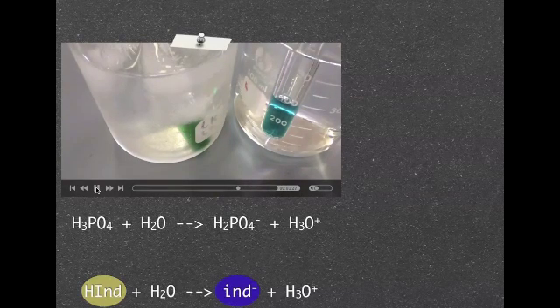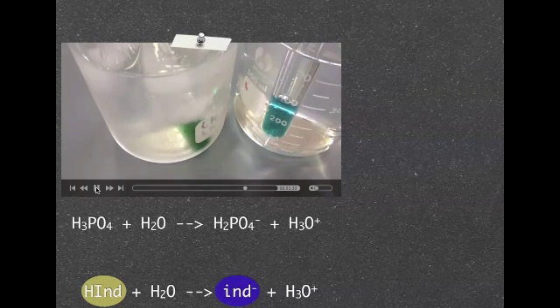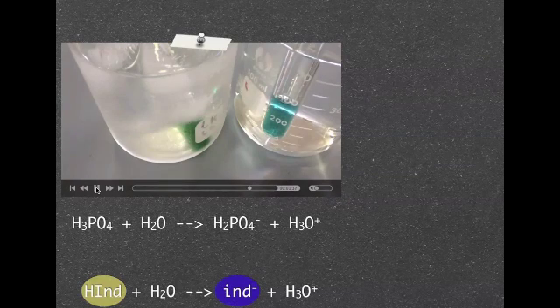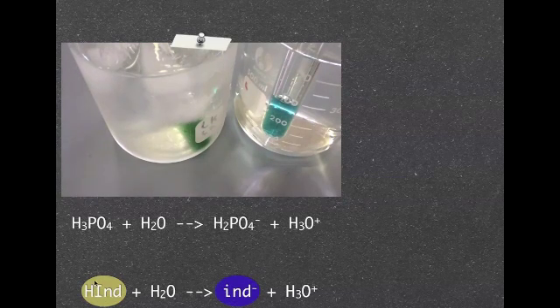You can see it pretty clearly there that the one on the right hand side has gone more of a blue color and the one on the left hand side there in the cold has gone a bit of a lighter green color, obviously due to the presence of this ion here a bit more.